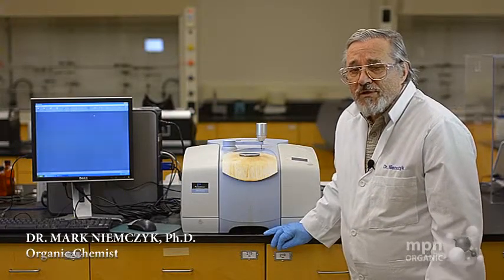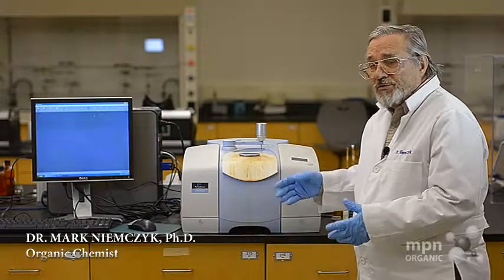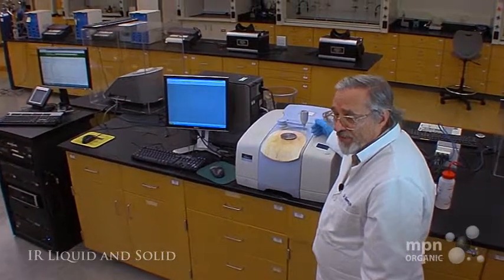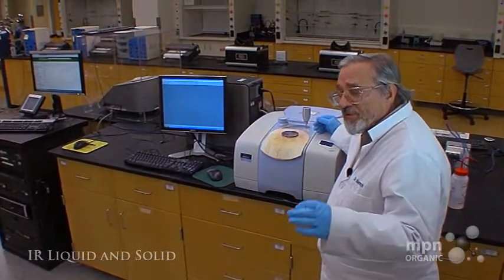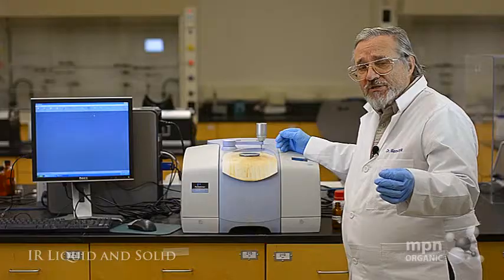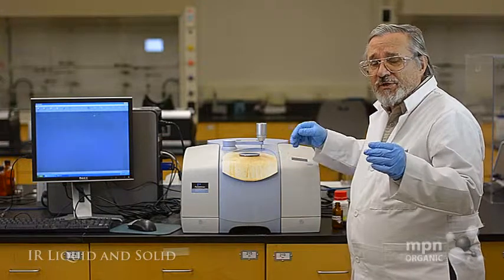In a previous video, we showed you how to use the Perkin-Elmer Spectrum 100 infrared spectrometer. But we didn't delineate between the taking of liquids and solids. I thought that I would take that opportunity right now.